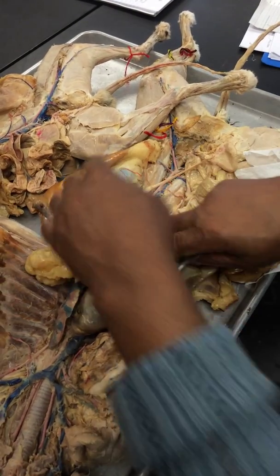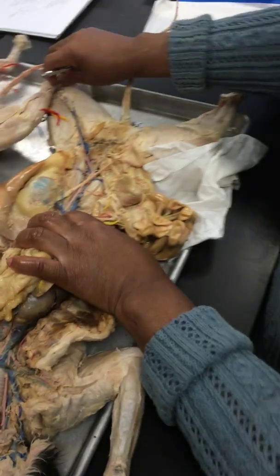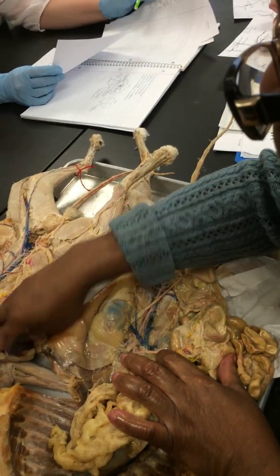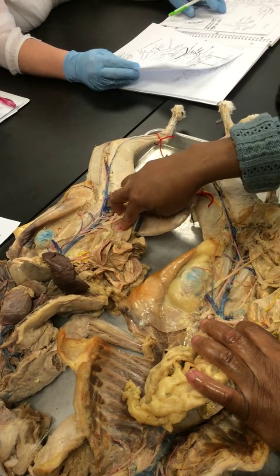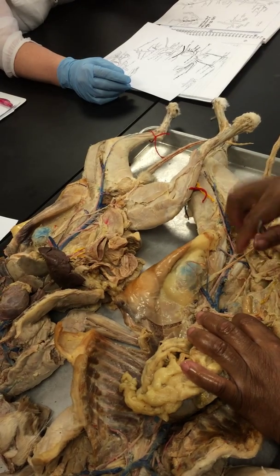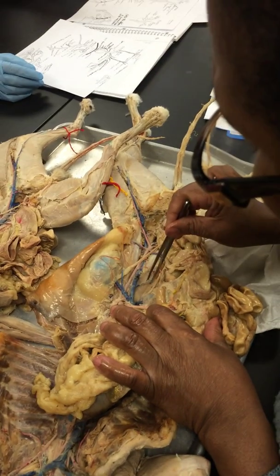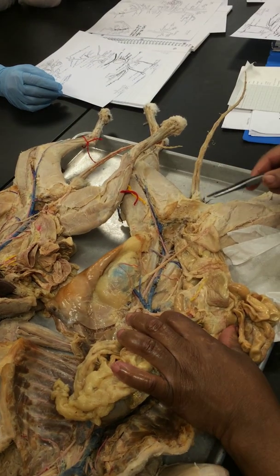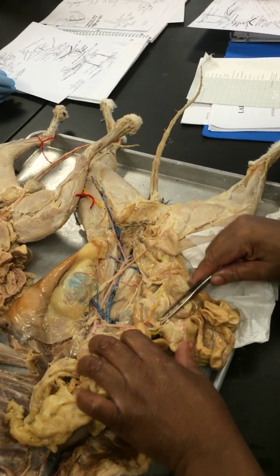So now let's do our regular. I had this over here. That one looks pretty good. Oh, you do have a little one here. Okay, so let's do the red ones and then we'll do the blue ones.